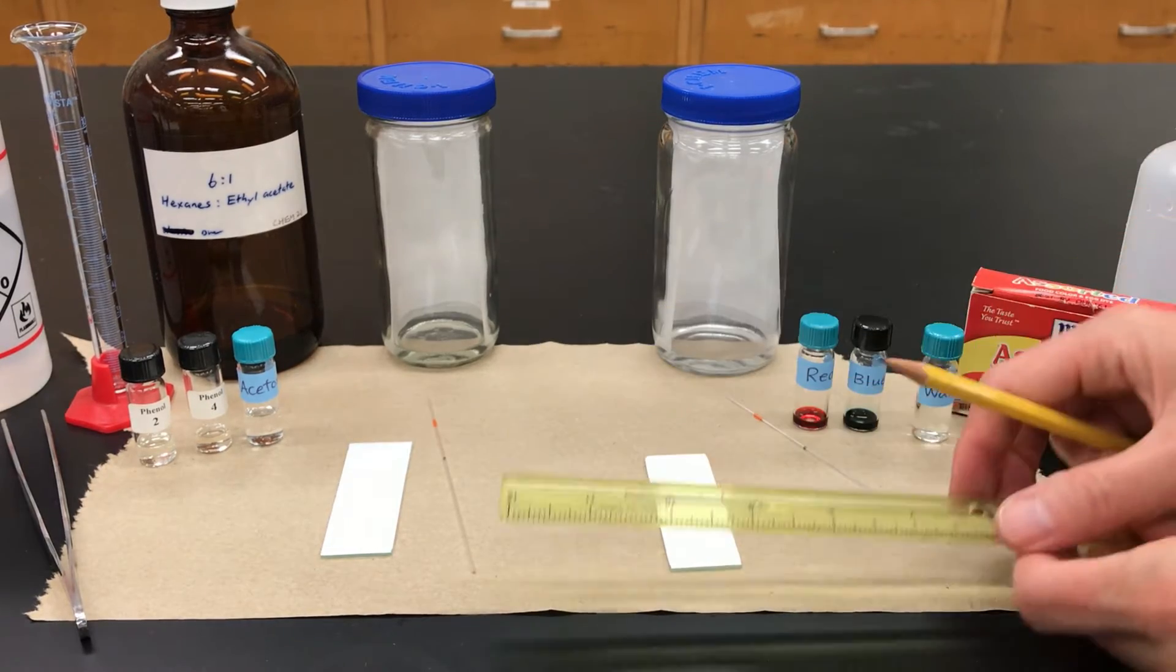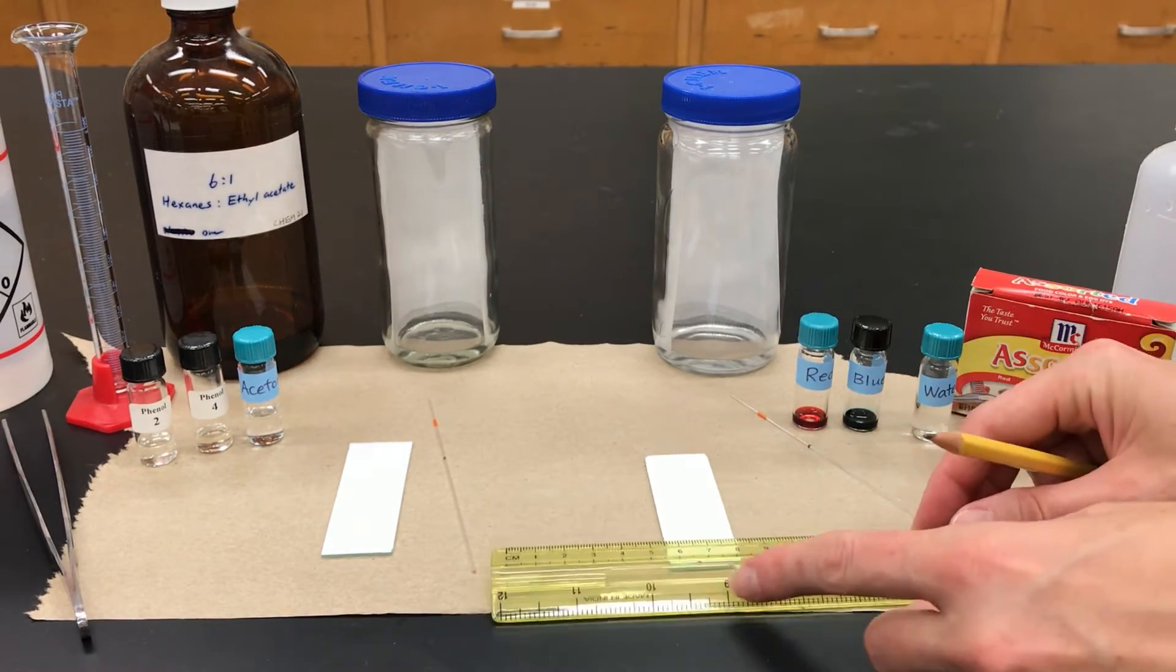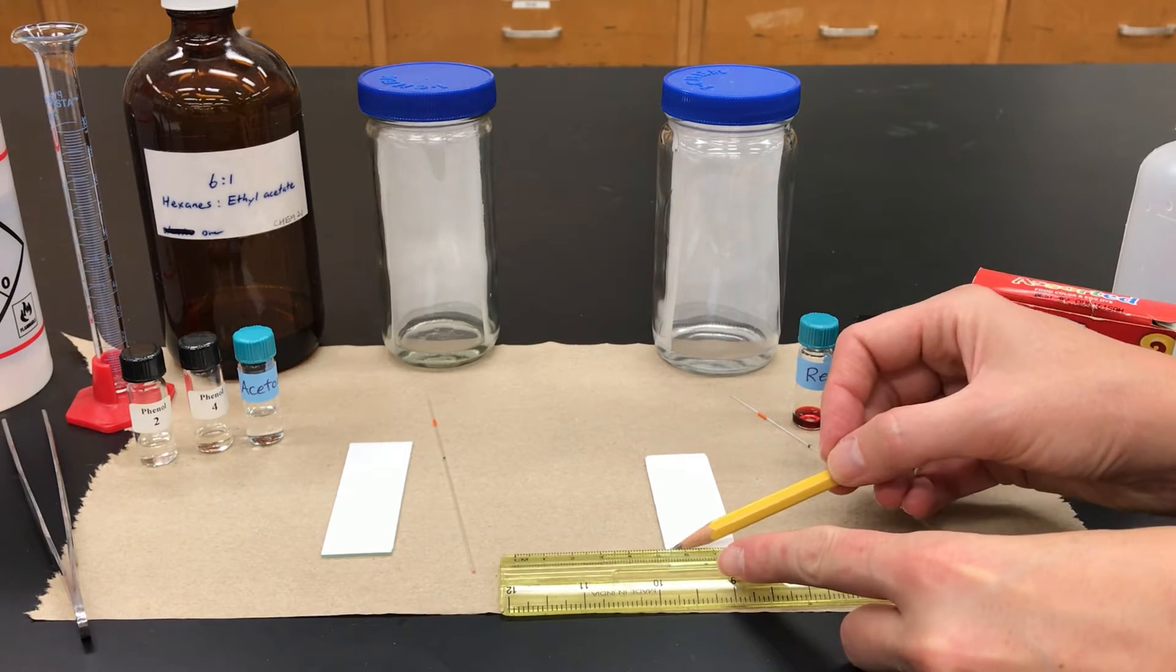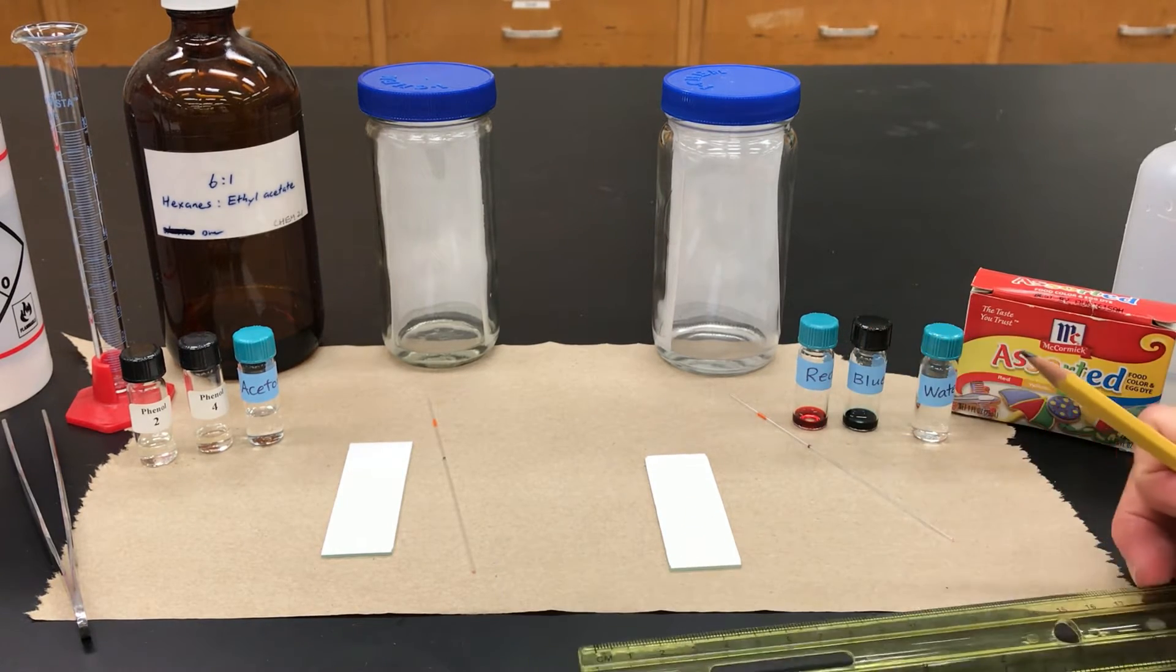You don't want to touch those plates on the front, you want to touch them on the sides.